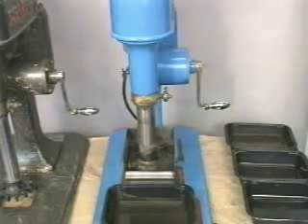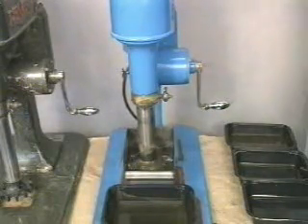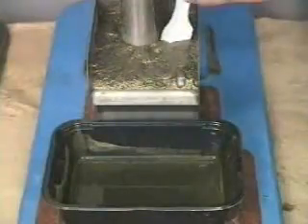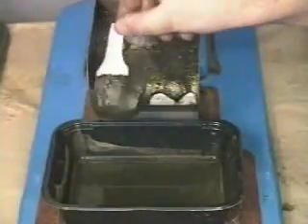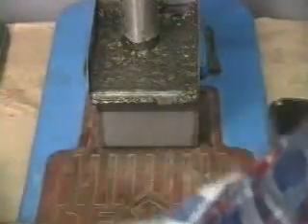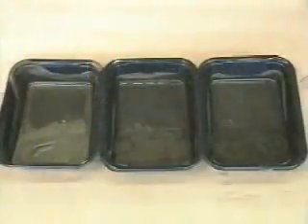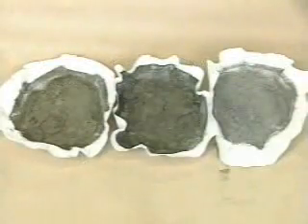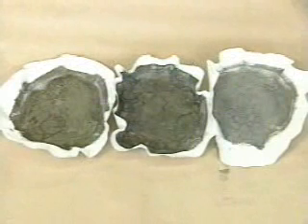This shows a laboratory flotation test for our simple chalcopyrite and gangue flotation system. In this test, the froth is collected in a pan for a certain period of time, and then the pan is removed and replaced by another. Each pan of concentrate is weighed and assayed for copper in order to calculate the copper recovery to the concentrate as a function of time.